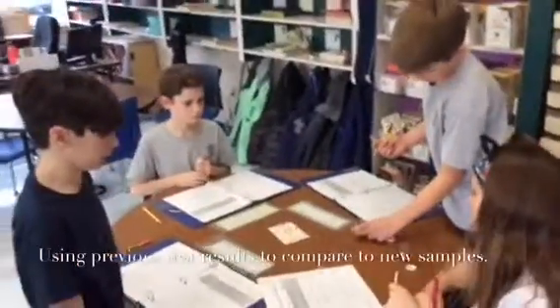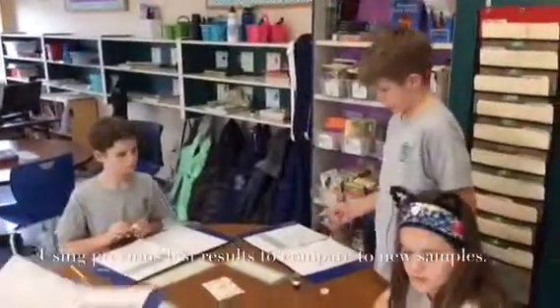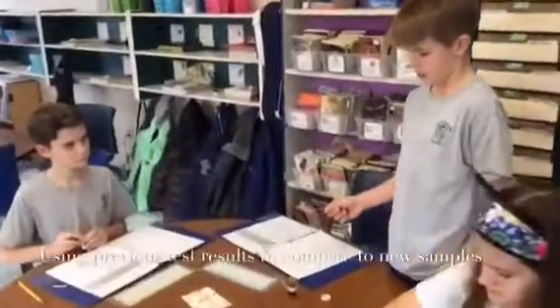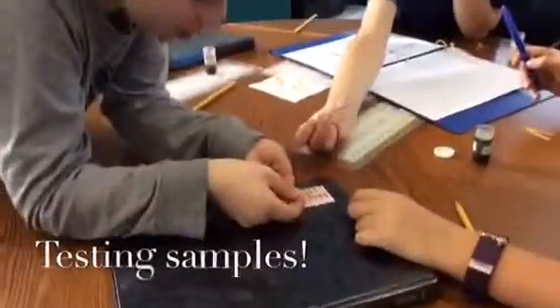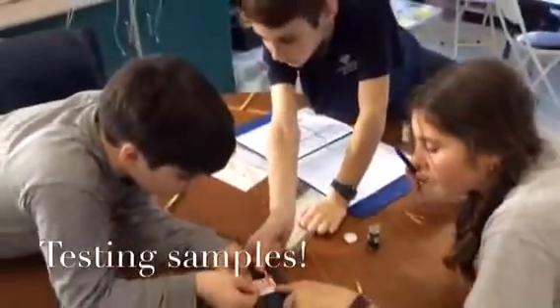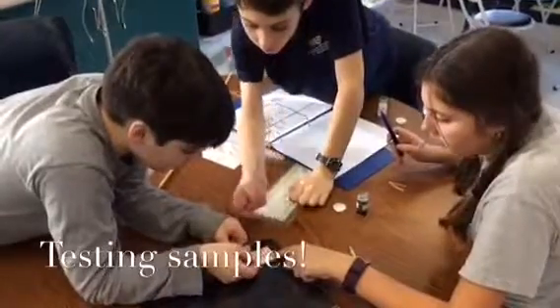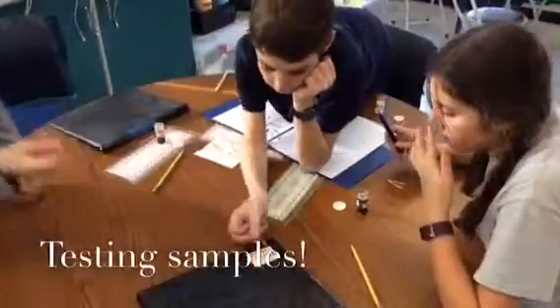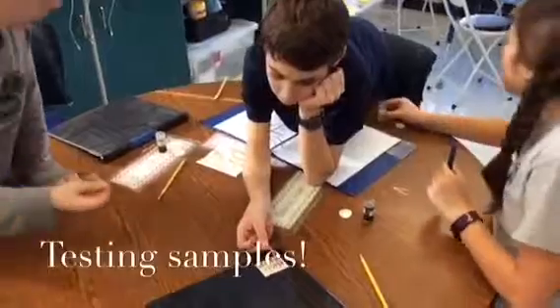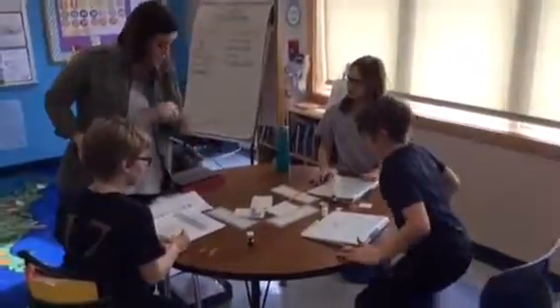So we are doing little tests to see what the pH level is for each of the soils. Mine's a 4. Yours is like 2. Yeah, that's because it's 5 and 8. So it's okay that you all tested separately? Mine's 4. What sample did you just test? So do you agree that it's a 6?